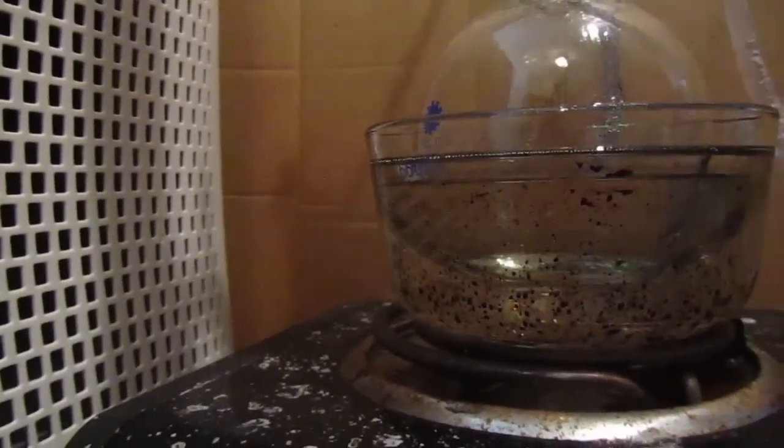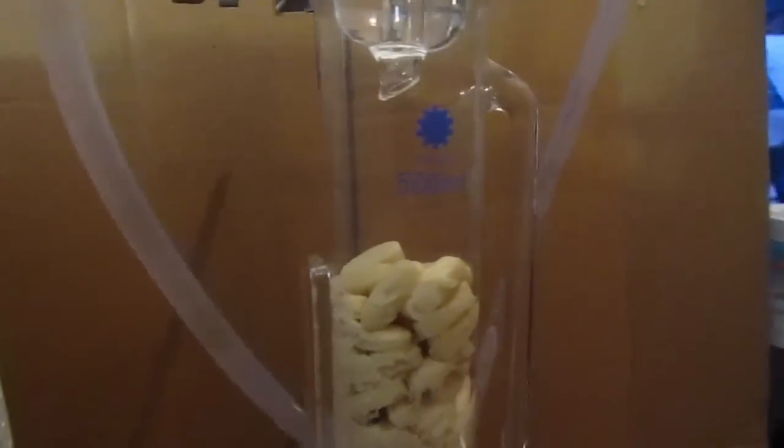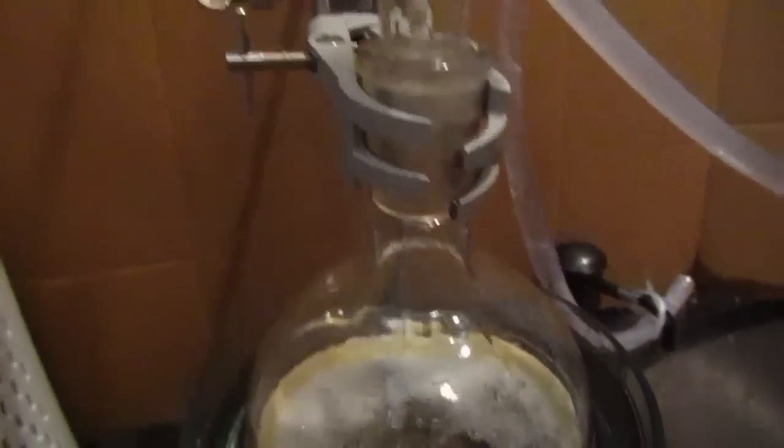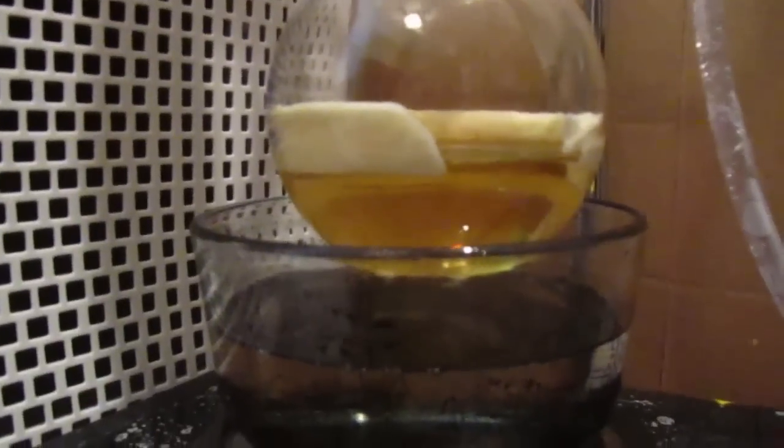And make sure not to spill your oil bath on your hot burner, or your whole house will smell like a very stinky candle. And while this is almost done here, not really, let it run for a couple more hours.